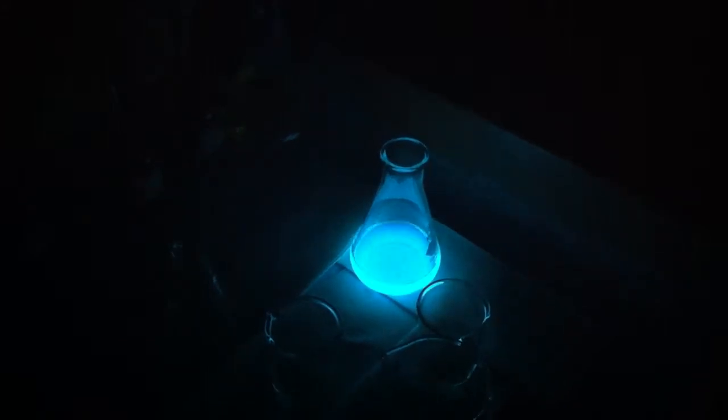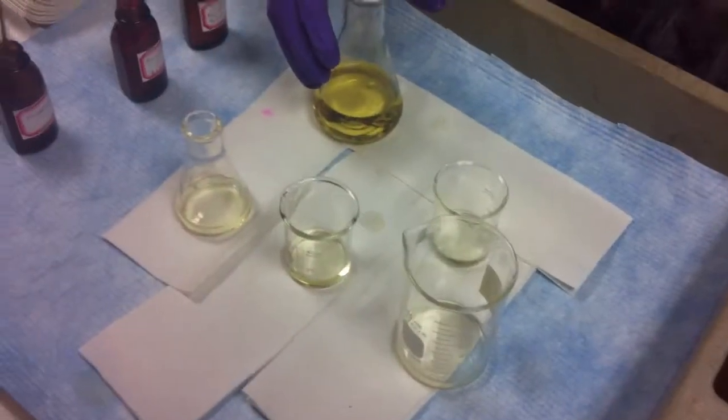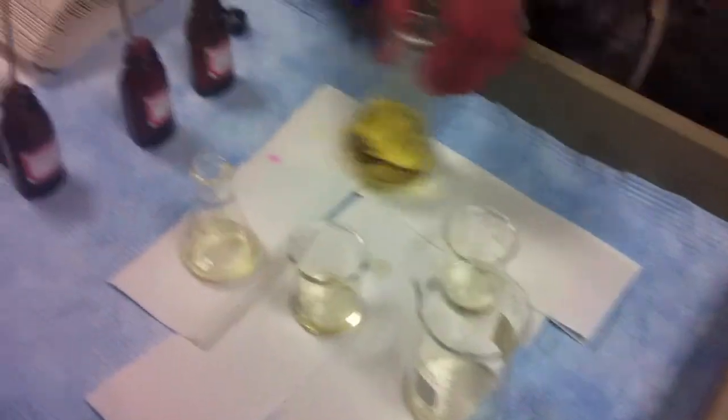Okay, so you have a medium blue, right? Yep. Pretty. Is it showing up on the thing? Yes, it is. Is it actually recording? Yes, it is. Okay, now we're going to put that over here.